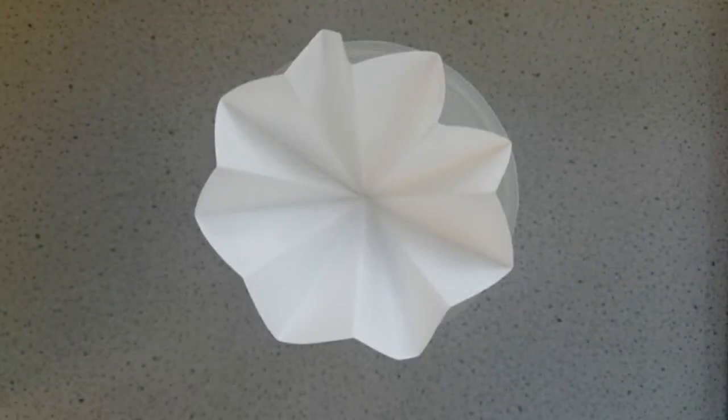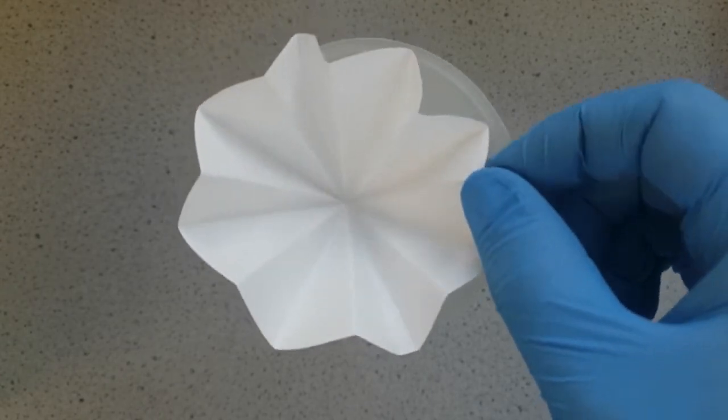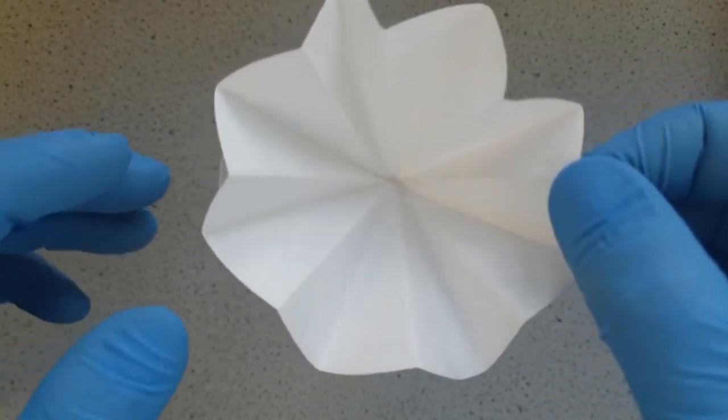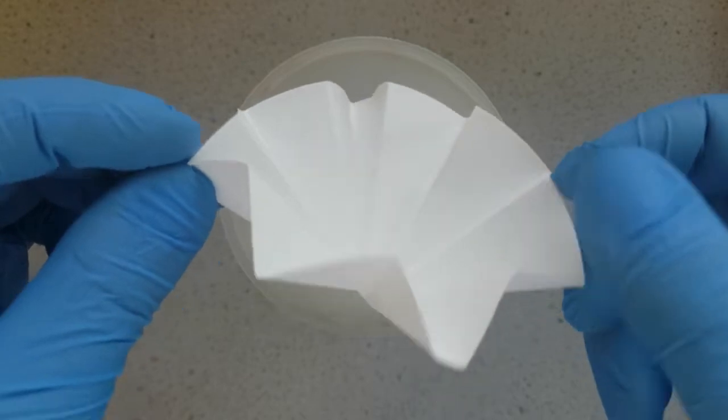In this video I'm going to show you how to flute a filter paper. We use fluted filter paper to increase the efficiency and speed of filtration when removing undissolved solids.